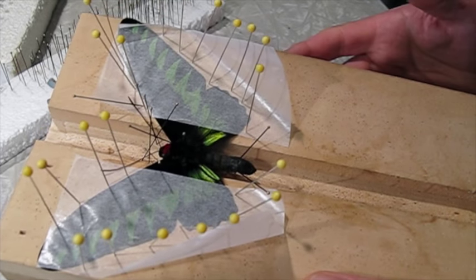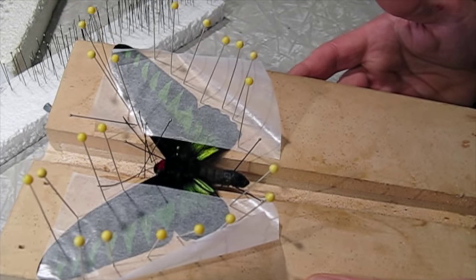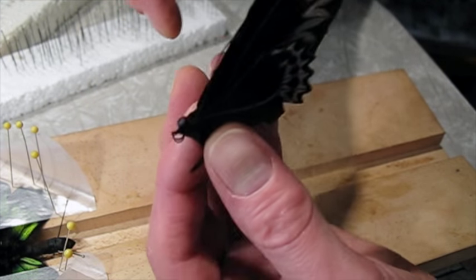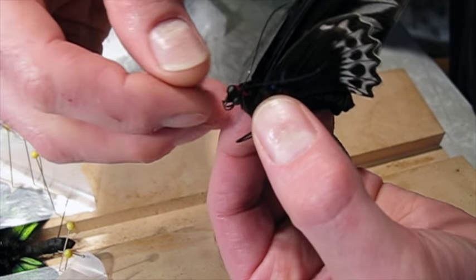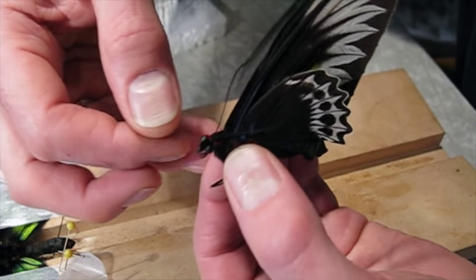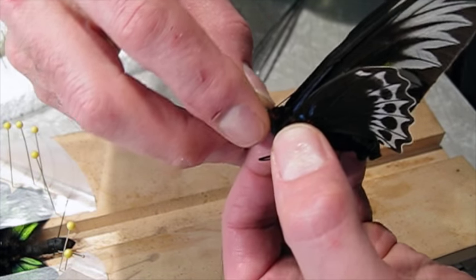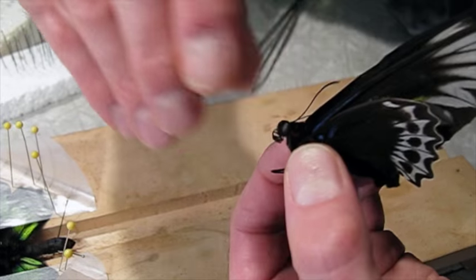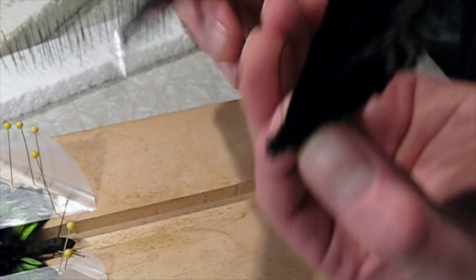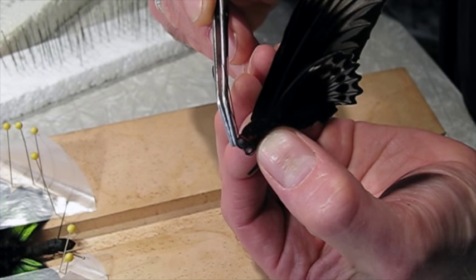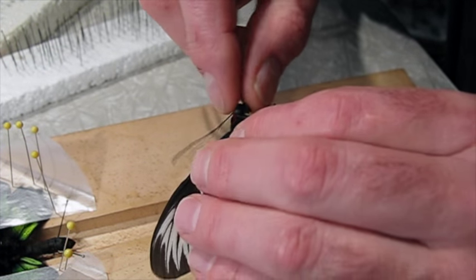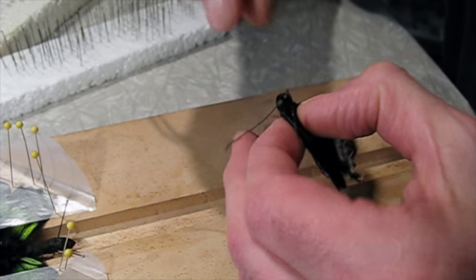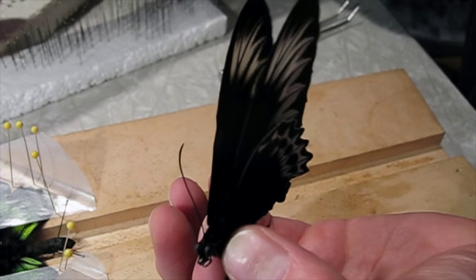Now on this female, the head is twisted to one side. This will make it difficult to get the antennas to line up. You can usually just grab the head, I usually just use my fingers on a big butterfly or tweezers on a smaller one, and bend it back in the opposite direction for a moment until it stays centered. It's also tilted a little bit. It's just easier to do this before you've pinned it up. You can spin the head around 180 degrees without it seeming to cause any problems. That's much better. Again, a large pin, a clean one, through the center.